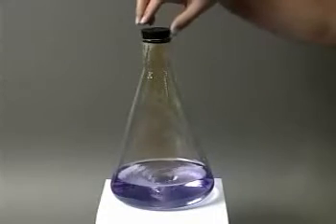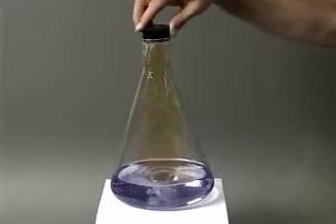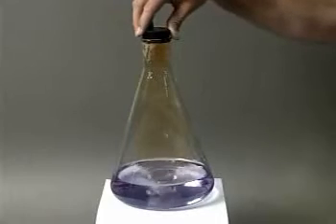Upon dissolving, the nitrogen dioxide reacts with water to form nitric acid, as indicated by the color change of the solution.